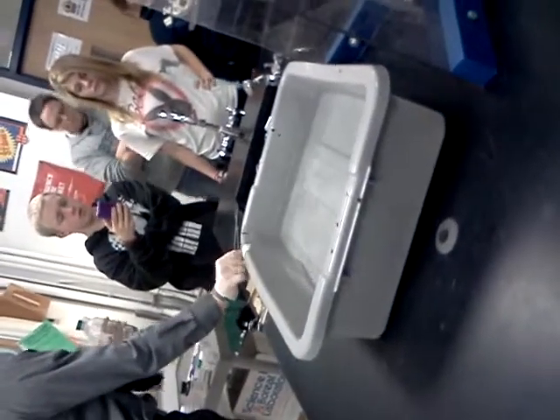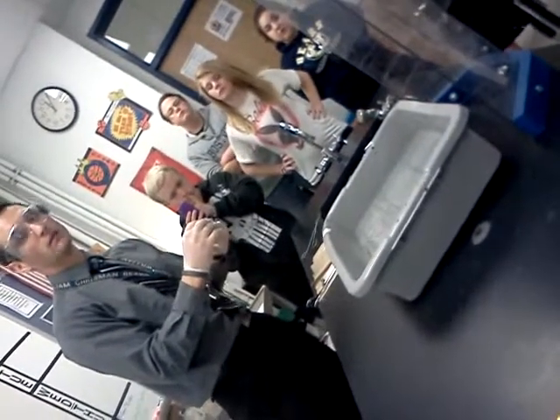This stuff is called phenolphthalein. Phenolphthalein is an acid-base indicator. What it does is detect the presence of bases. Lithium hydroxide is a base, and hopefully lithium hydroxide will be created from this reaction. What happens is the lithium will actually tear apart the H2O of the water, and then it'll recombine. When it recombines, it gives off energy. So hopefully it'll give off enough energy to catch on fire. We'll see. It might not.